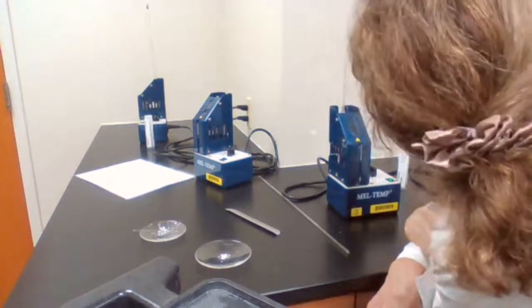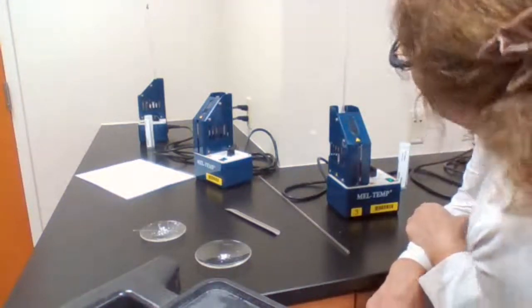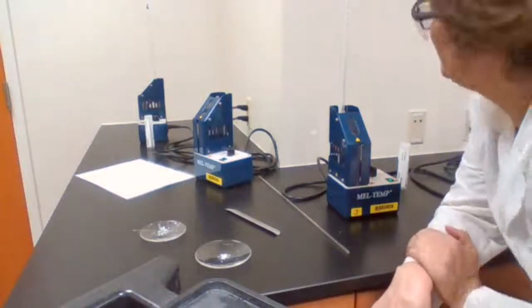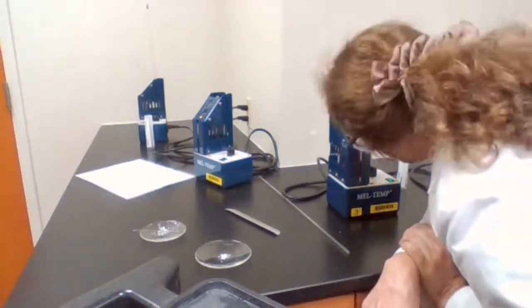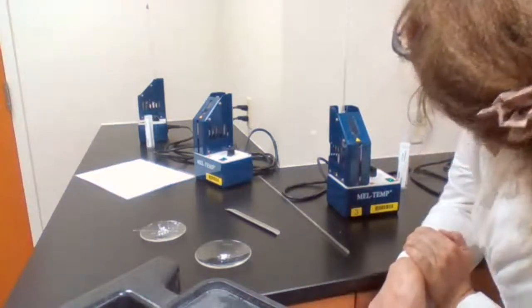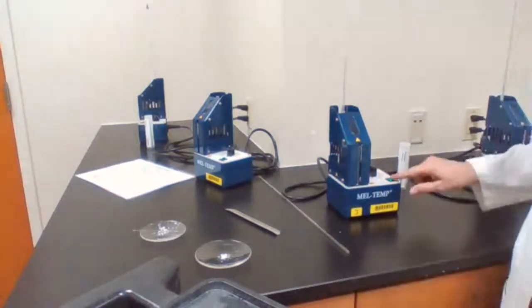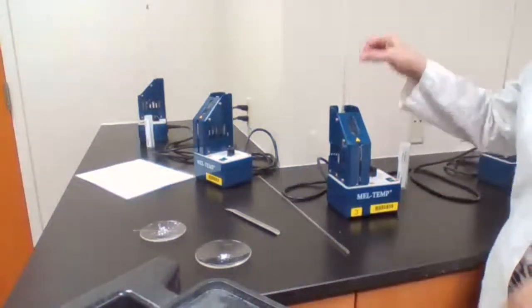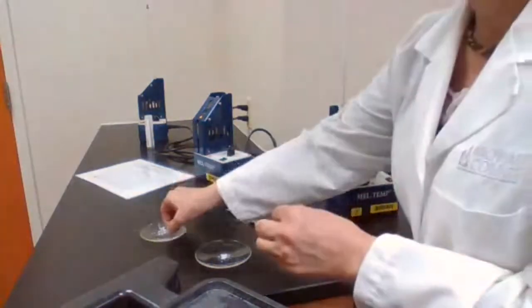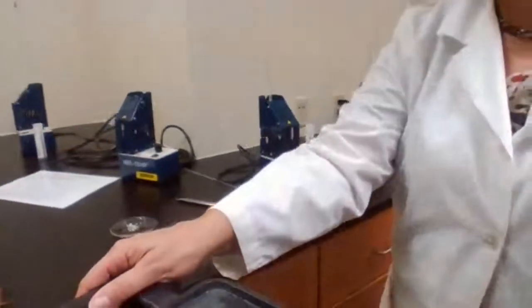Okay, melted at 118. Started at 118 and completely melted at 120. 118 and 120. Yes.